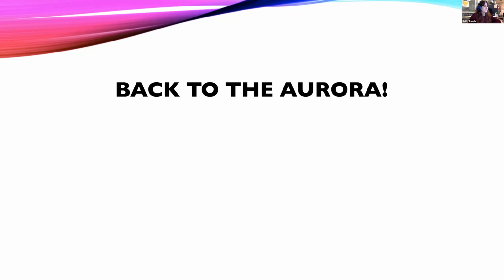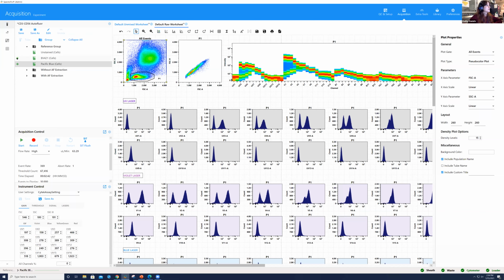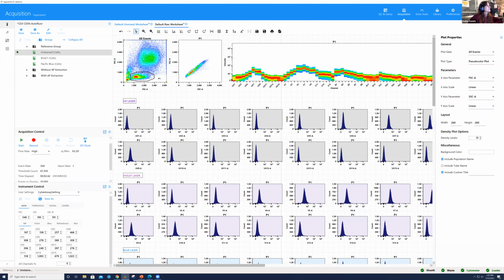So the good thing is we absolutely have time, because the beautiful thing is it's nice and easy to do in the Aurora. So I'm going to go ahead and share the screen again. But it absolutely is something we'll be able to cover. And there was one question in the Q&A that we should have time for as well. So we already covered in setting up the experiment how we go ahead and do the unmixing. So what I'm going to do, we have this experiment set up here, and there is one quick thing. So actually what I'm going to do first, I have to create a new experiment and import these raw files in just to show very quickly. Okay.